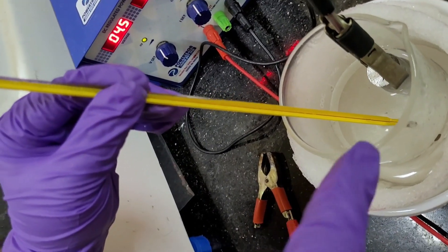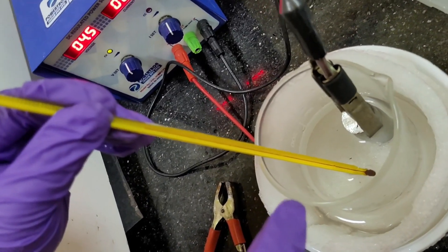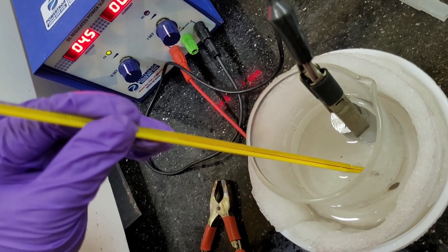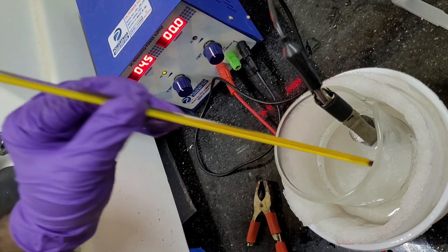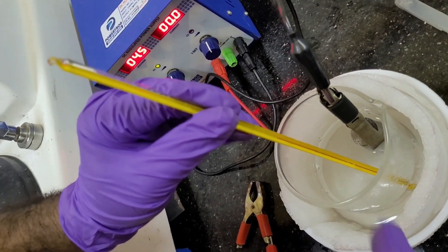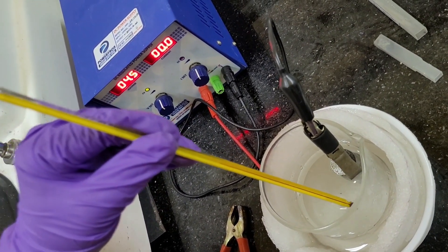You can see inside the beaker how we are measuring the temperature. And the very important thing is to note that, we don't have to touch the probe of this thermometer to the body of the beaker. Because in that way, the body is more cooler, more chill.